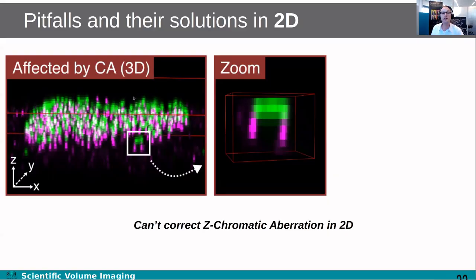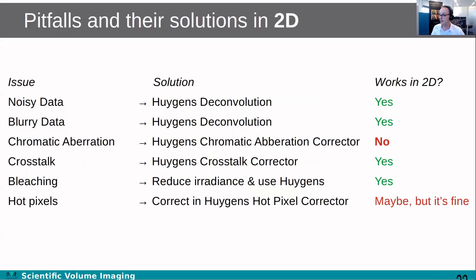If you do 2D colocalization, you need to be aware of chromatic aberration in Z especially. If, like in this picture, there's a shift in Z, then to capture both channels, you'd need to measure two planes at least. If you only measure a single plane, then you will miss the information of the data that's in the other plane, like you can see from this picture. So if you have that, then you might want to consider trying to correct for it, or at least check if you have a chromatic shift in Z before you acquire your data. Shift in XY is not a problem, so only Z you want to be aware of. The other issues are essentially fine. Crosstalk, noisy data, blurry data, bleaching, hot pixels, all of them are not a problem. And the analysis is not a problem as well.